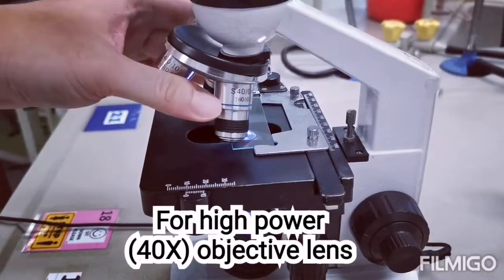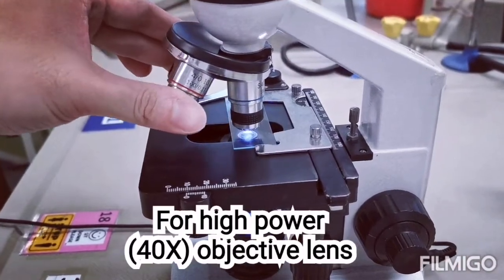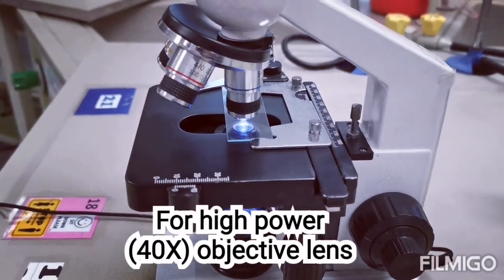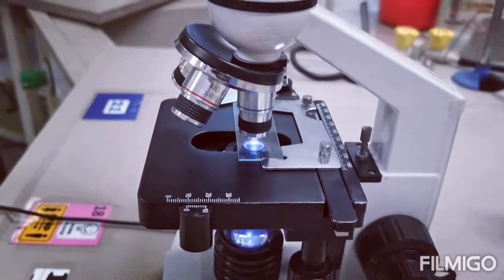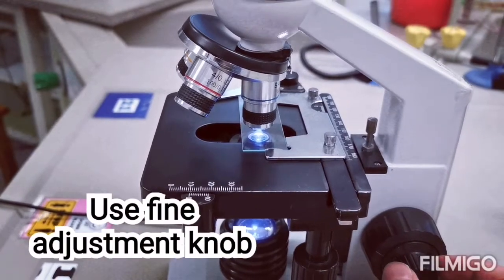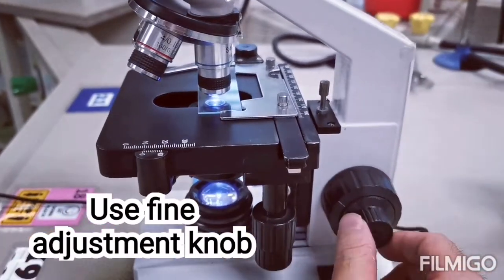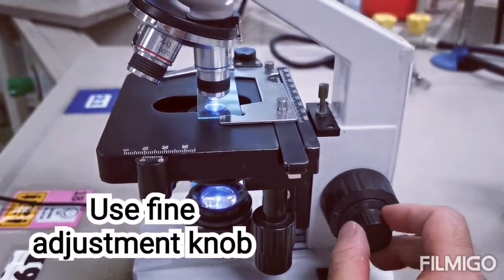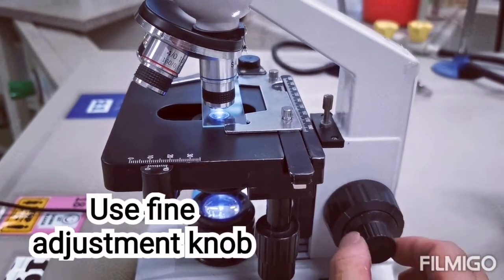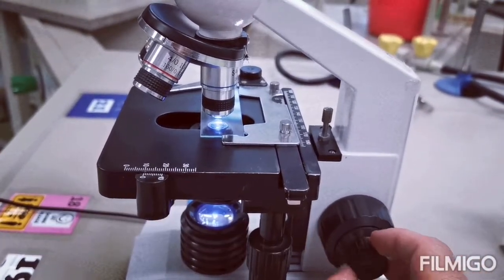And if you are trying to obtain a focused image under the high power objective lens, or the 40 times objective lens, the stage and specimen is already very close to the objective lens. Hence, you will also use the fine adjustment knob in order to adjust the stage and obtain a focused image.